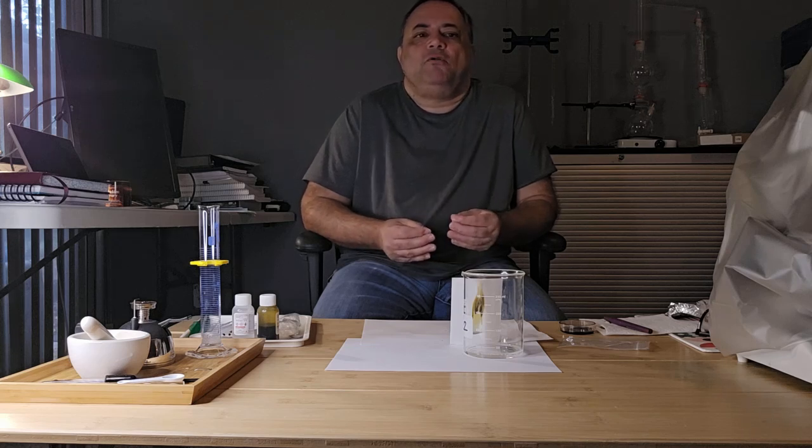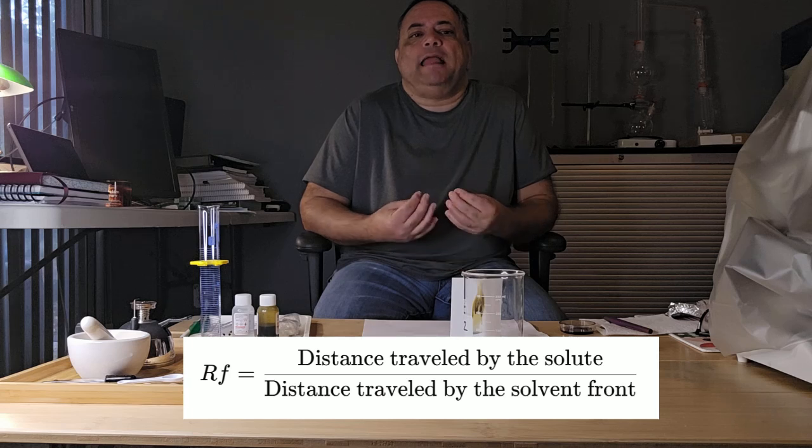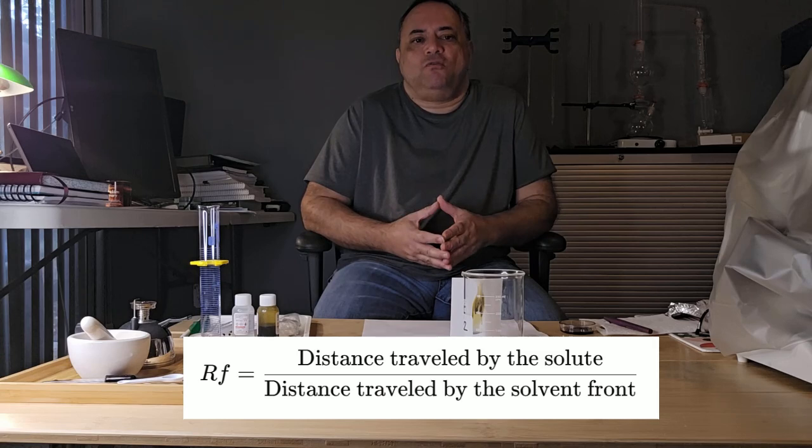Now, when you separate different components, you can identify specific components by the retention factor. The retention factor allows us to identify a specific component. This value compares the distance traveled by a pure sample to the distance traveled by the solvent.